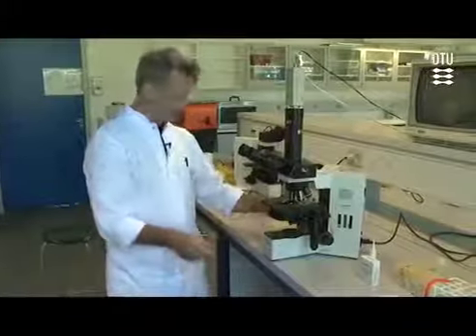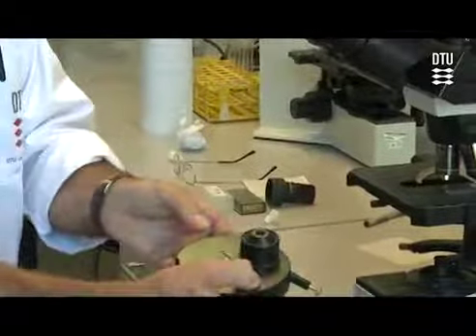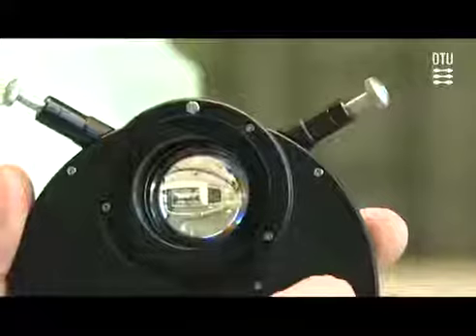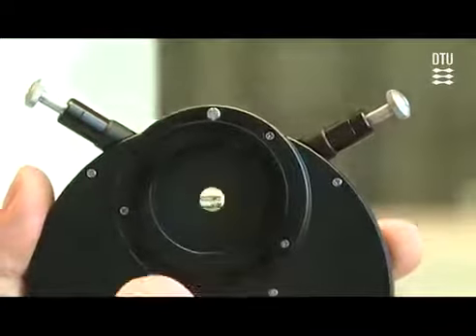You can see we can lower it and take it out, but don't do that yourself because it's hard to get it right again. You can take it out, and it has a range of settings, which is easier to see if you look at it from this direction. You can turn it around, and the first setting is just the open one. If we look at it up close, you can see we can close an aperture almost totally, but that's only possible in the first setting.